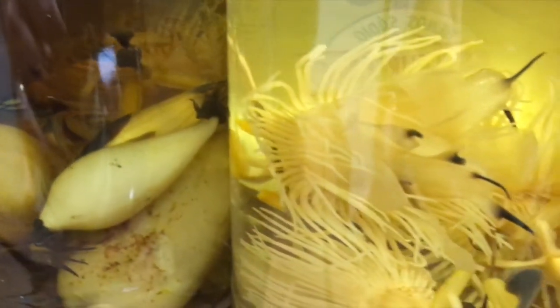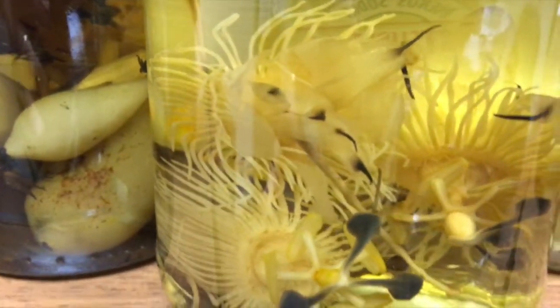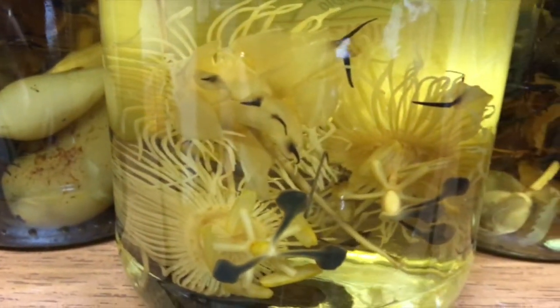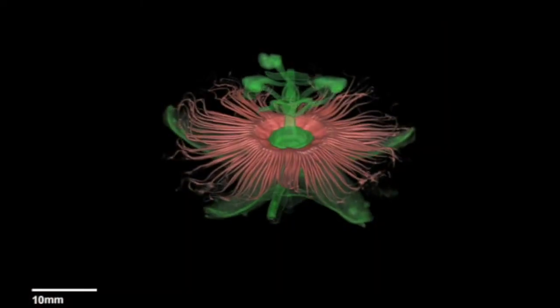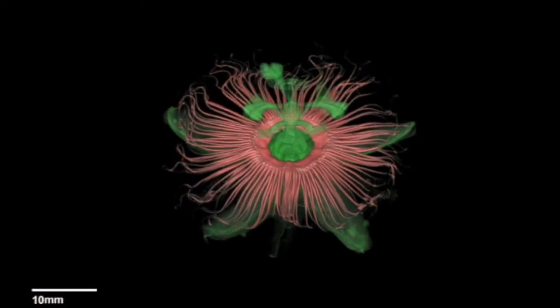As the technique is non-destructive and generally does not require further sample preparation, rare fluid-preserved museum samples can also be imaged and returned without damage.